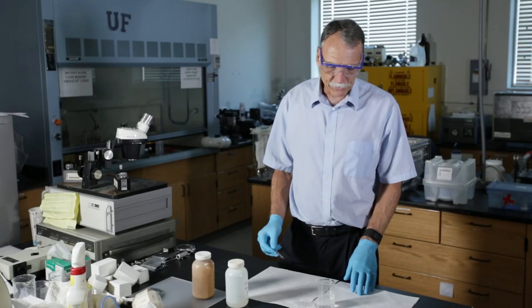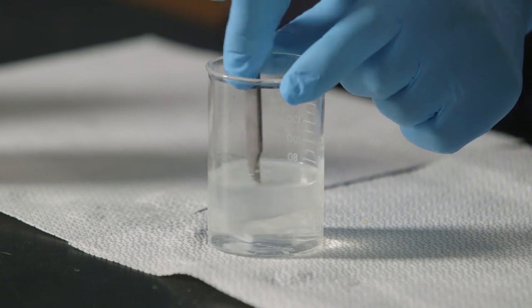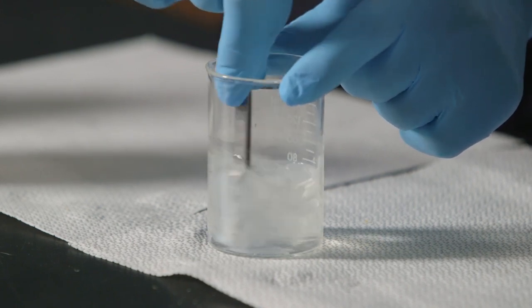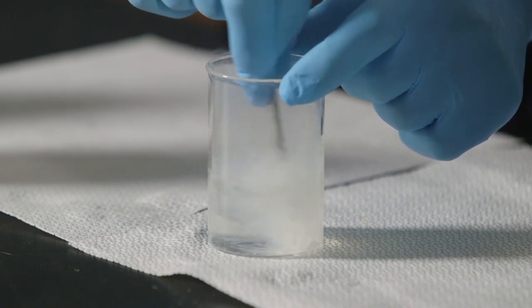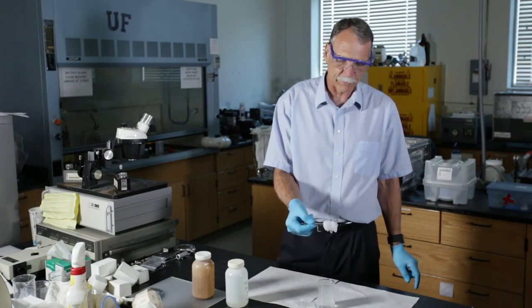All right. So you don't have to just do it at the interface. You can actually just stir it up. And if you do that, then it'll start to react completely. And you can see what's going to happen here. I'll pull out a whole glob now of nylon that's formed.